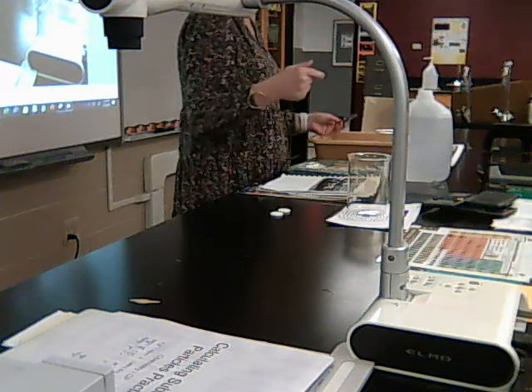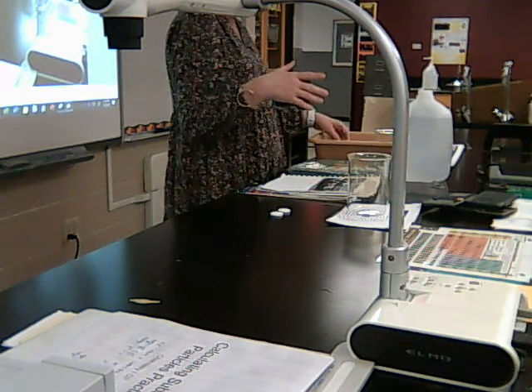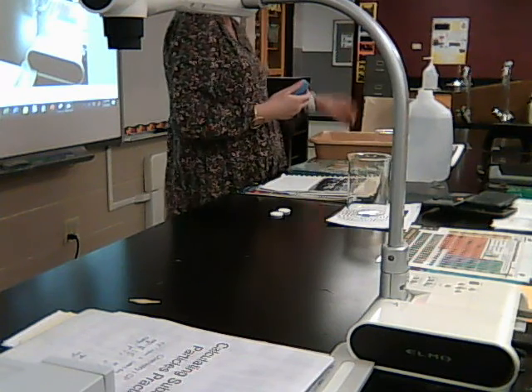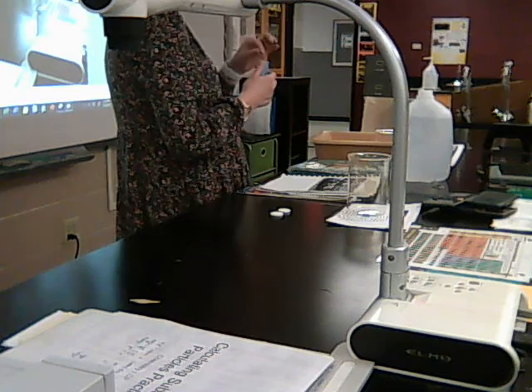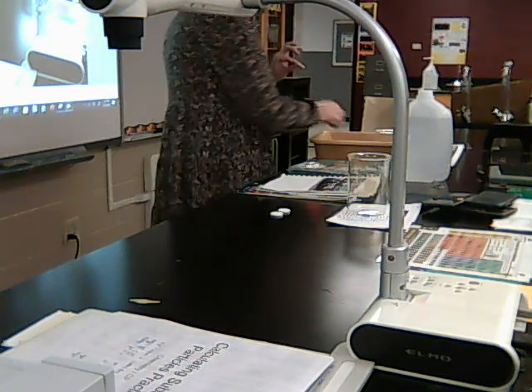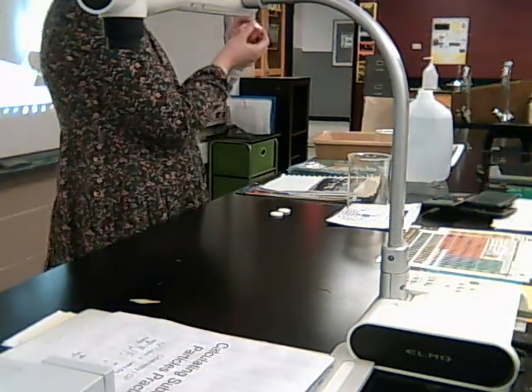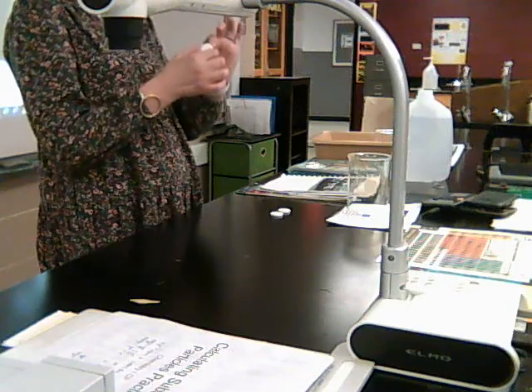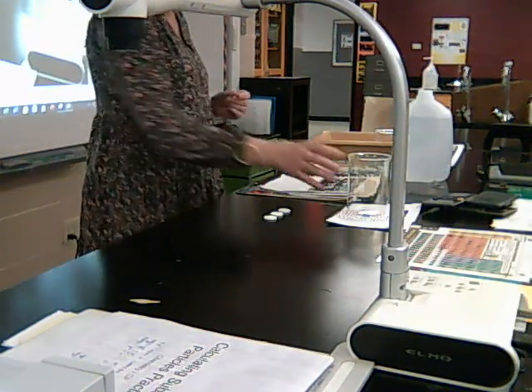There's also generic ones, called Equate. You guys ever seen those at Walmart? I need 3 because I'm going to do 3 different trials, or 3 different groups. So I've got 2 regular Alka-Seltzer tablets and 1 Equate generic. Those are the 3 I'm going to use.